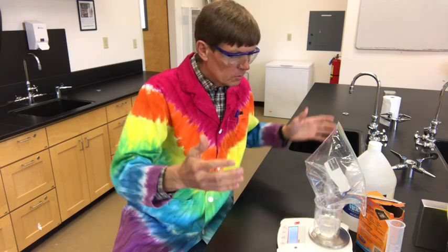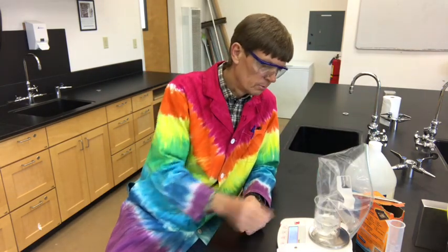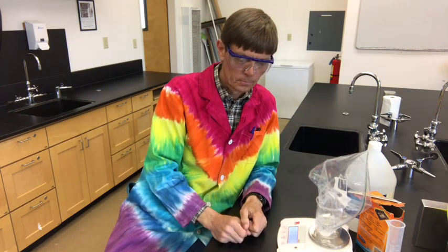So the atmosphere actually lifts things up. Now it's not enough to make it float like a hydrogen balloon, but it is 2 grams lighter, at least on the scale. The same mass is here, but the scale feels like it's 2 grams less. And that concludes the first part of the sodium bicarbonate and acetic acid lab.